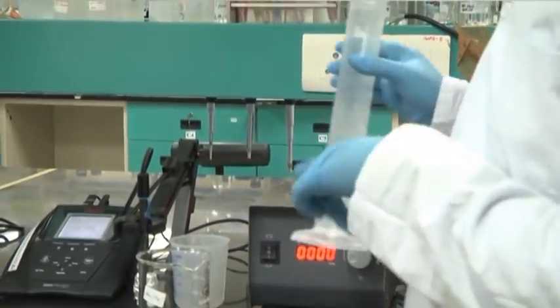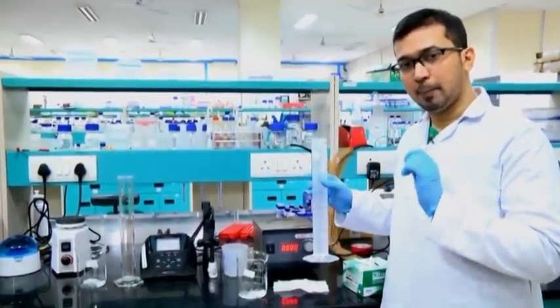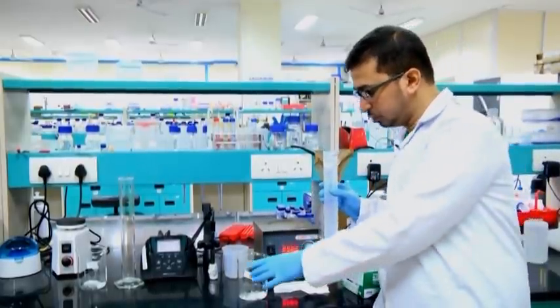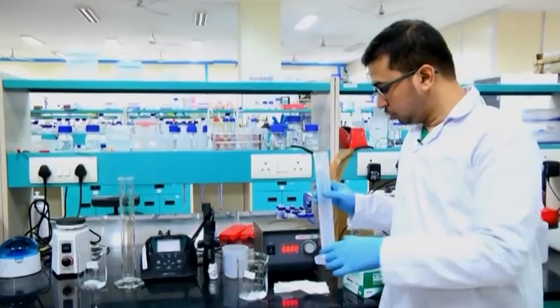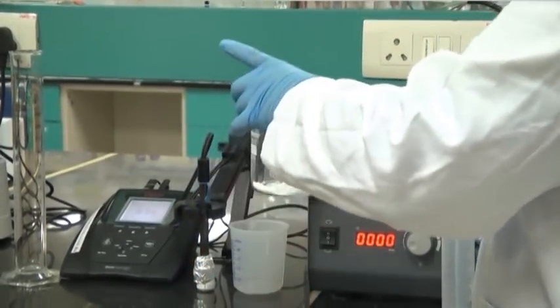Here we have taken double distilled water. We will not add 250 ml double distilled water directly at the first go, due to volume adjustment — a volume error might occur. Since we are adjusting it to around 100 millimolar, molarity calculation requires volume adjustment. So we will be adding roughly around 200 ml.